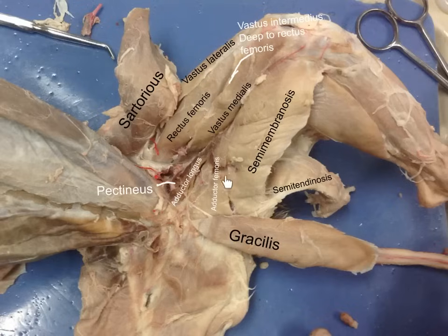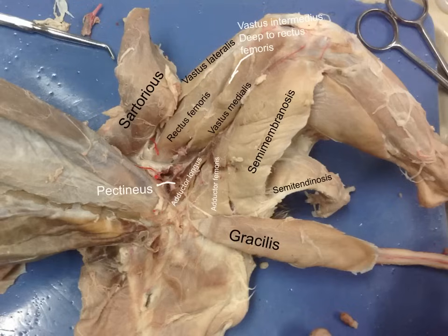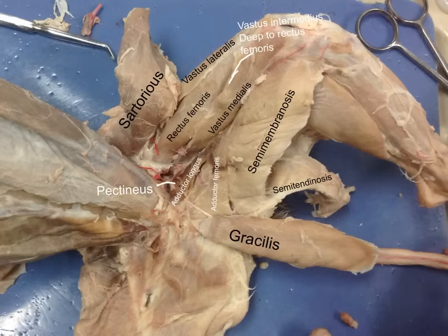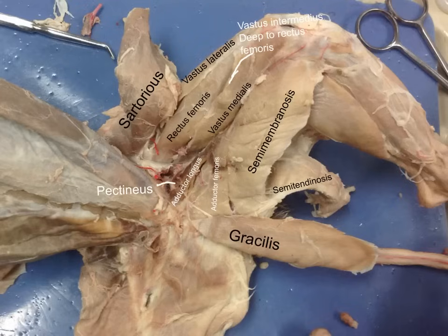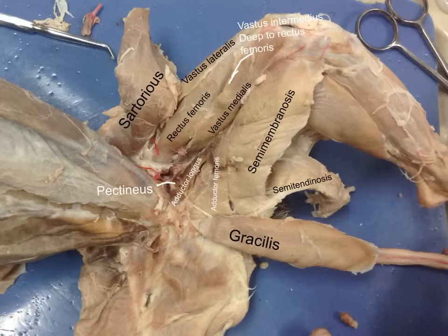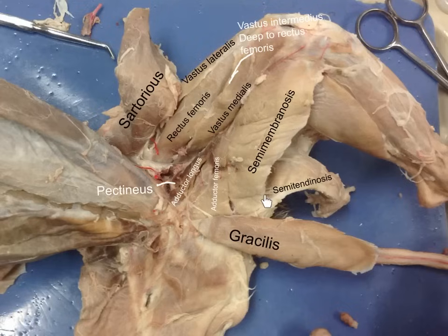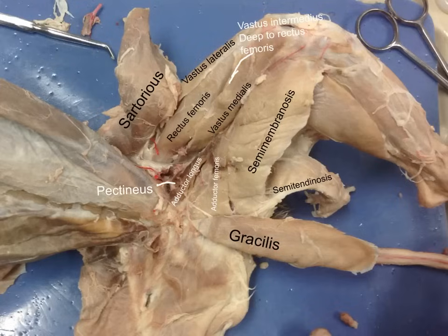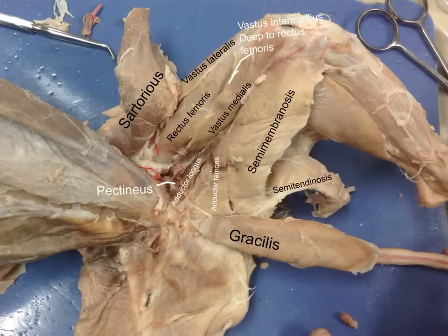And then we have our adductor muscles. The adductor femoris is usually larger. The adductor longus is usually a little bit darker of a muscle. And I'm going to be honest, the pectineus muscle is not real visible at this point. The semimembranosis is the larger of the two. The semitendinosis, as you remember, is closer to this tendon. Alright, that should do it. Hope this helps.